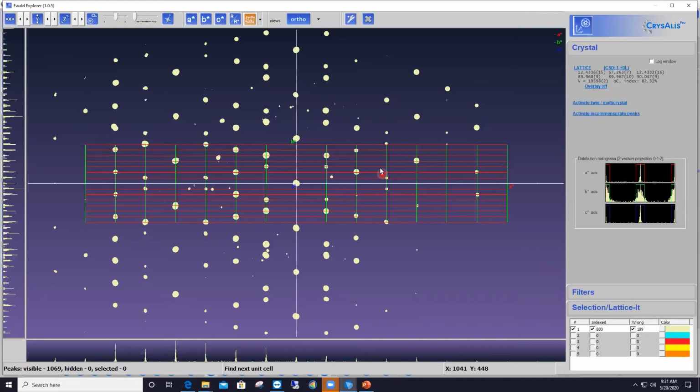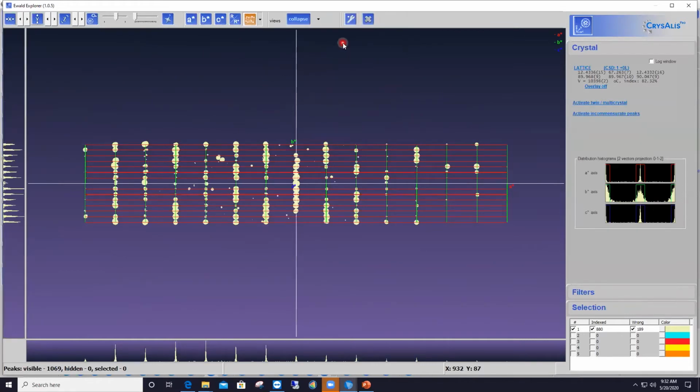Now, if you project that whole pattern onto the left-hand side axis here, or another way of saying that is if you collapse the entire diffraction pattern on top of the lattice, so basically bringing all these outside reflections on top of the lattice, I can do that by going to another option at the top of the interface and opening the pull-down menu near the button that currently says ortho, and then I select collapse to lattice range. That allows me to bring all the reflections within the area of the lattice.